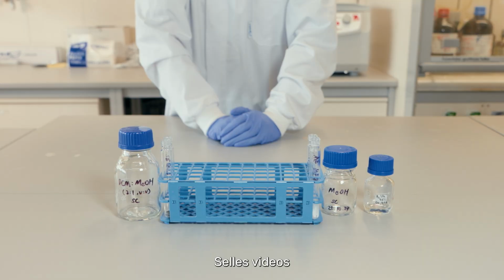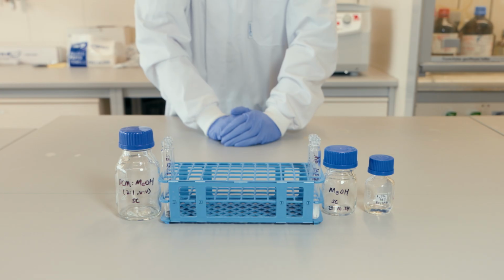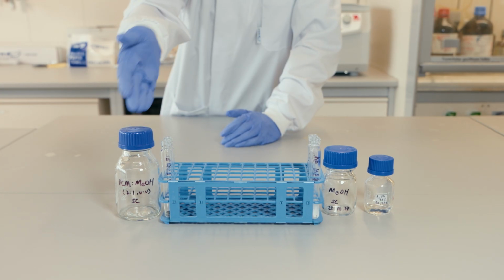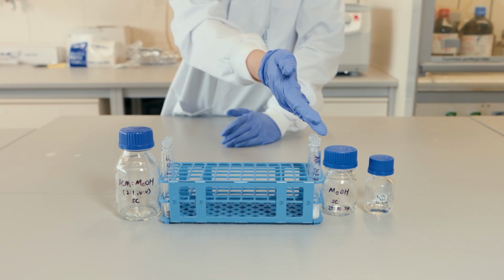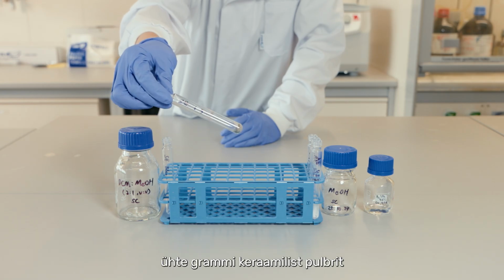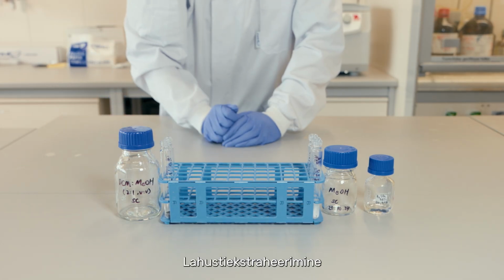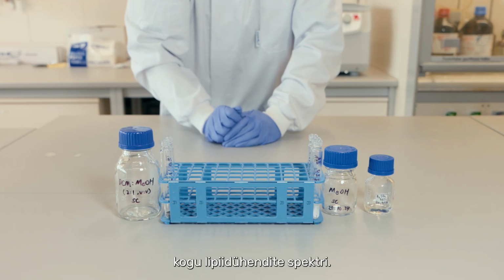Hello. In this video, we will walk through the protocols for lipid extraction. There are two common methods in the lab: solvent extraction and acid extraction. For solvent extraction, we will need around 1 gram of ceramic powder per sample. We will use DCM and methanol as solvent. Solvent extraction can recover a full spectrum of lipid compounds.